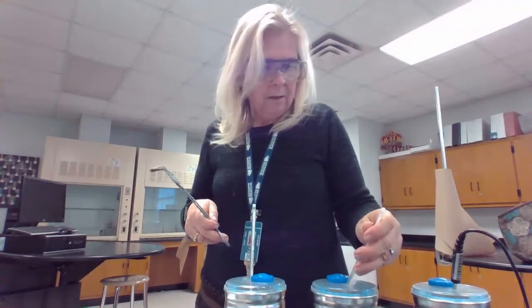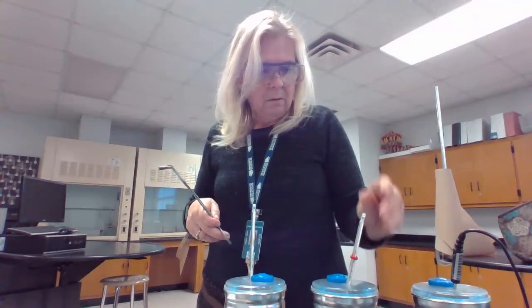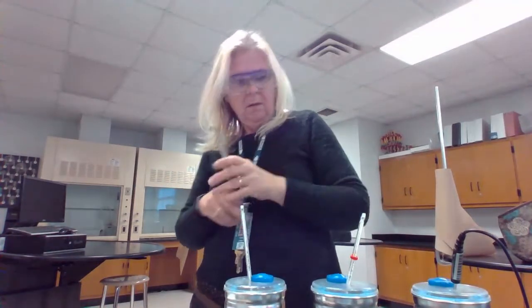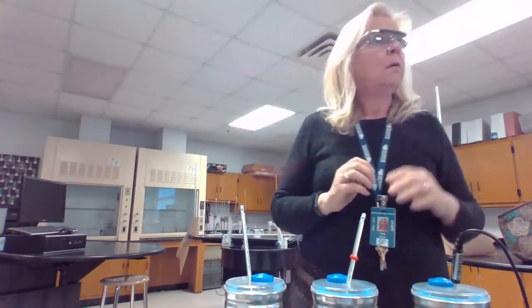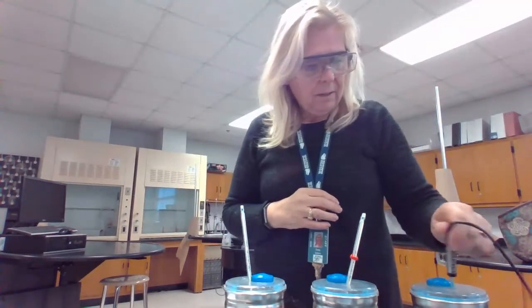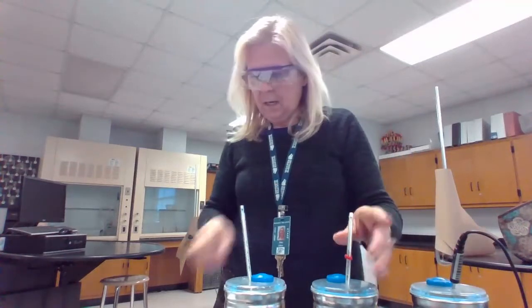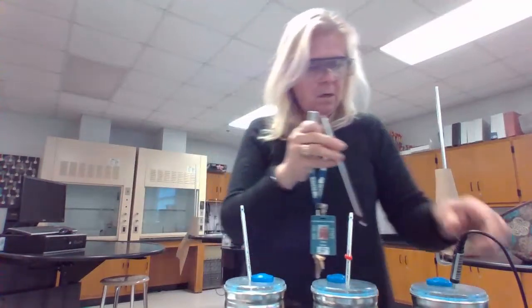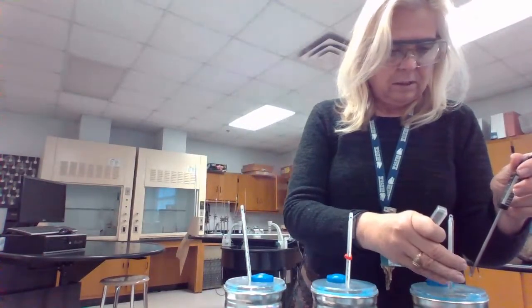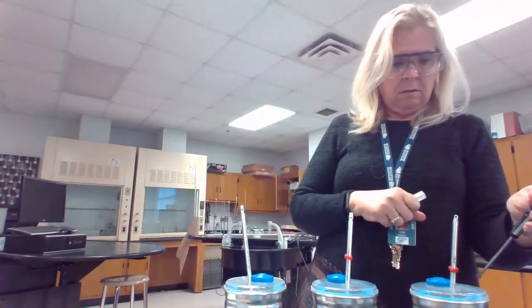Are these all having problems? We're going to give this some time to think about things. That one's broken. Let me see if I can use a different thermometer for this. I don't really want to use the temperature probe for that.